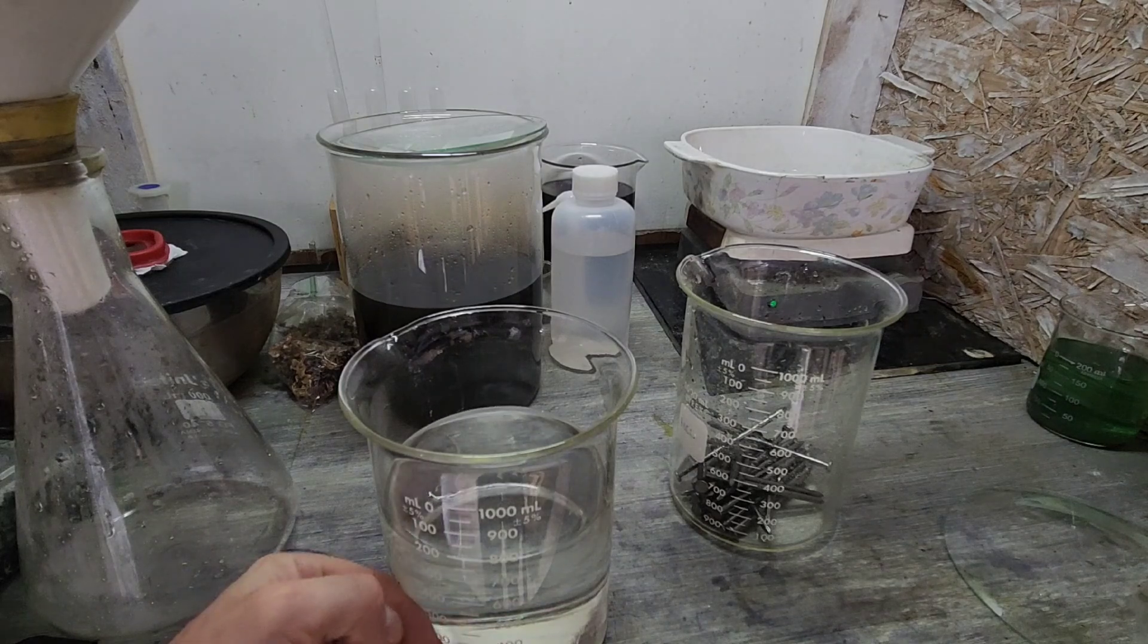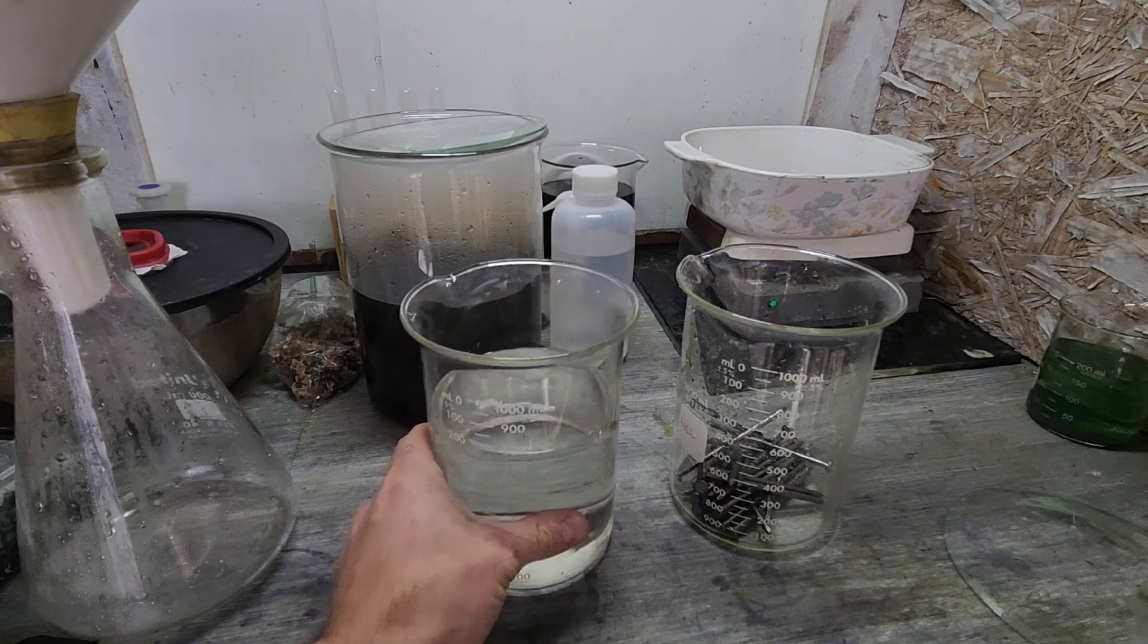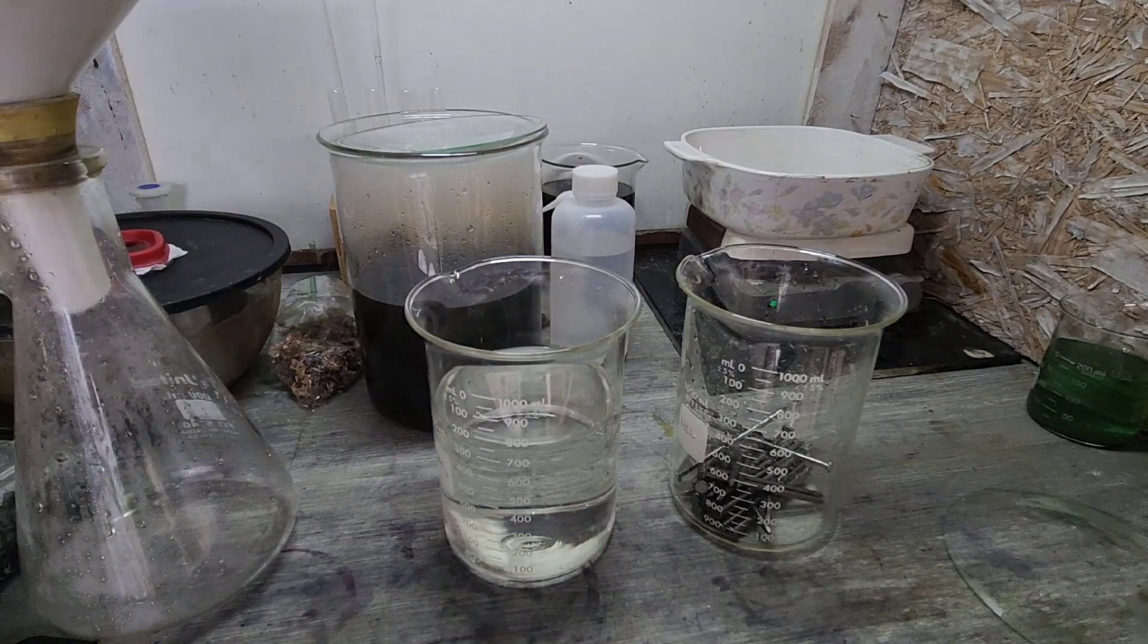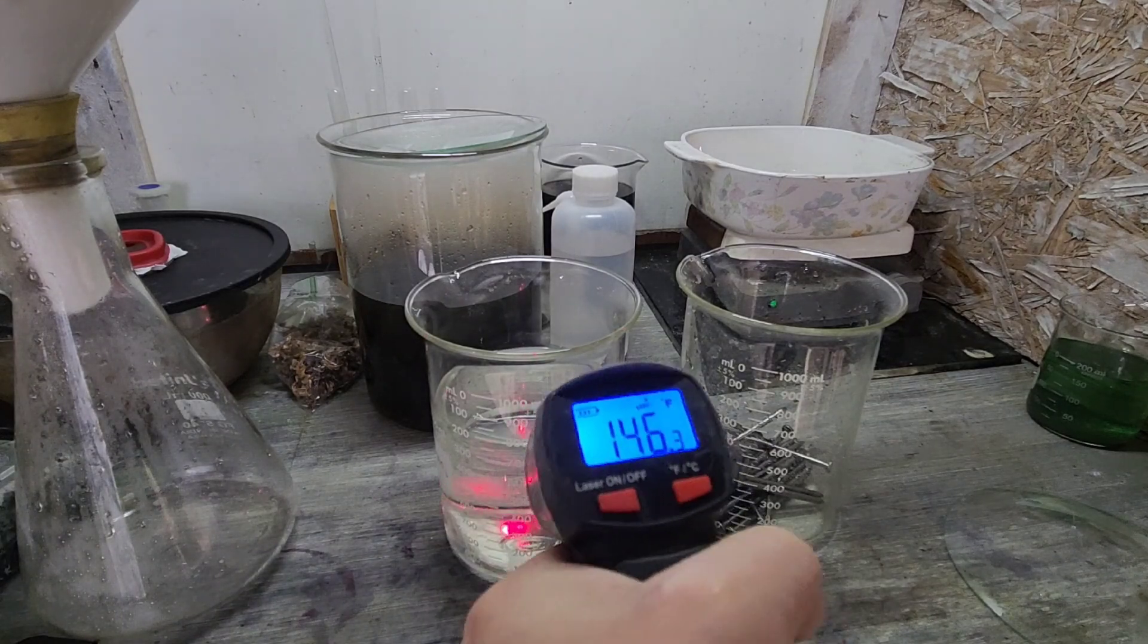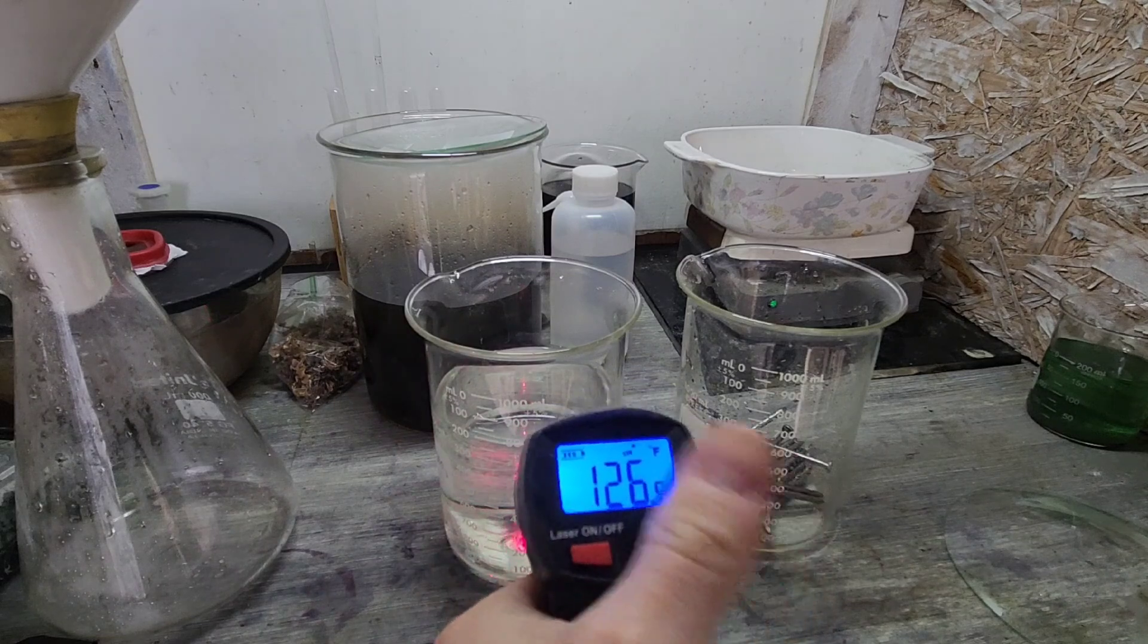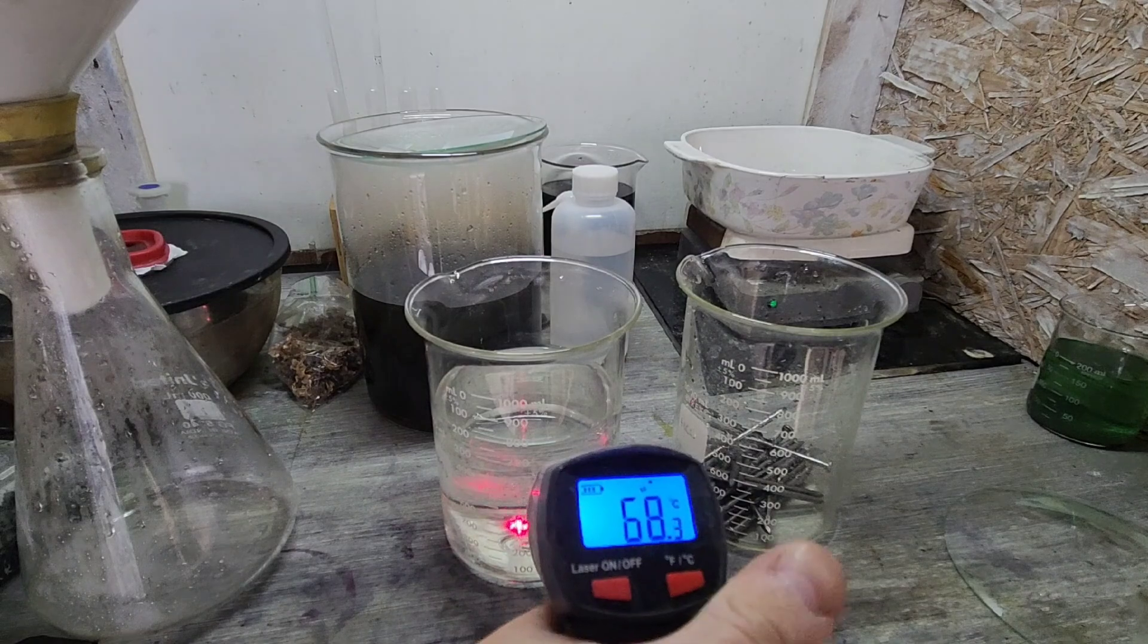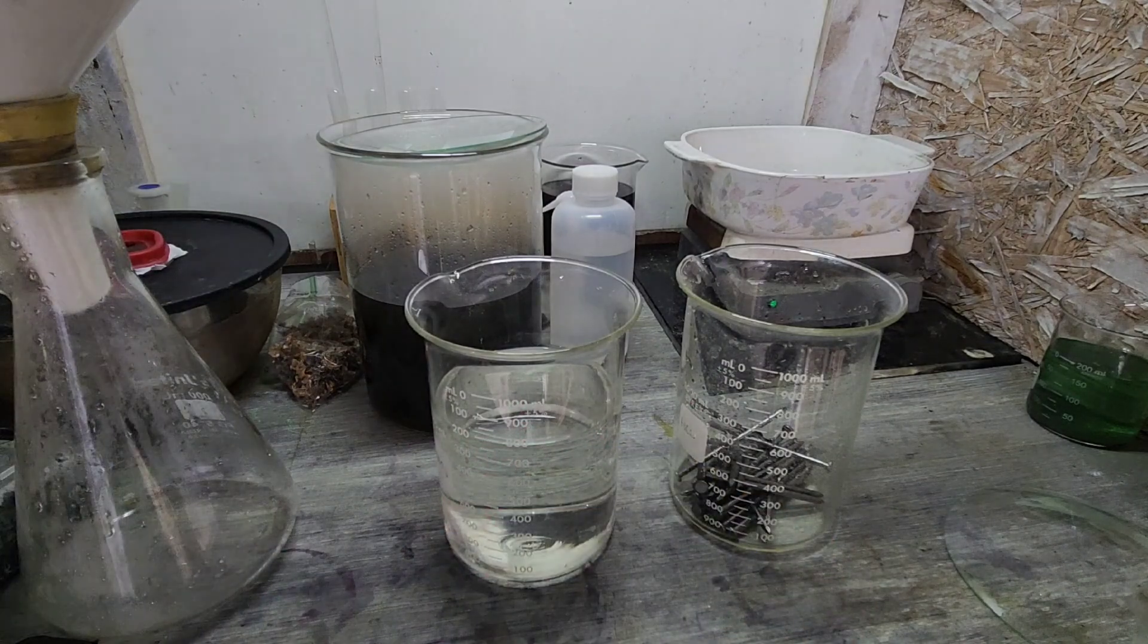Temperature - it's an exothermic reaction so it gets pretty hot, got to be careful. Just like that, 146, 148. Let's see here, 67, 68 Celsius. So it gets pretty warm, so just be careful with that.